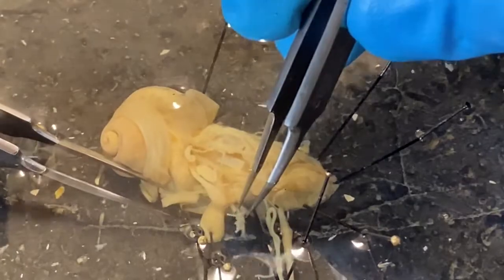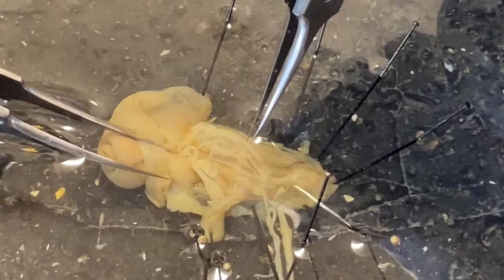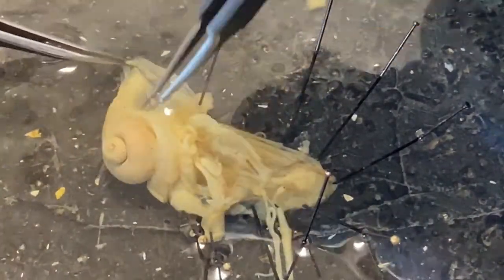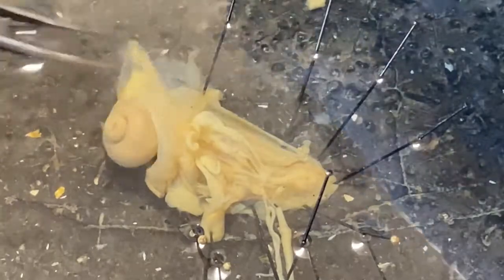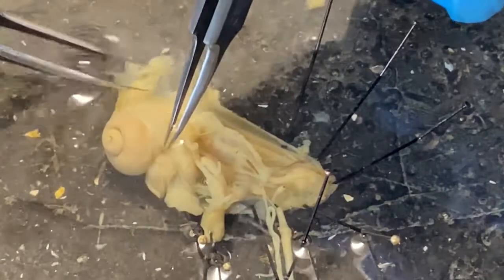So we've got the dart sac, the mucus glands, the penis, and the vas deferens as well as the oviduct coming down through here. This yellowish material in here is going to be your kidney, and there's a loop of the intestine that comes up here, follows this line, and terminates right here at the pneumostome so it can release its feces.